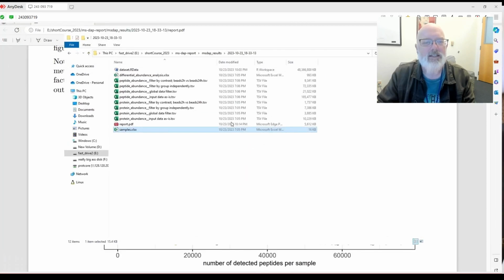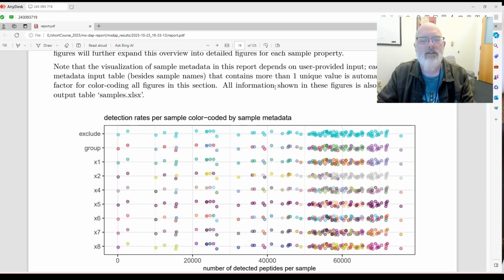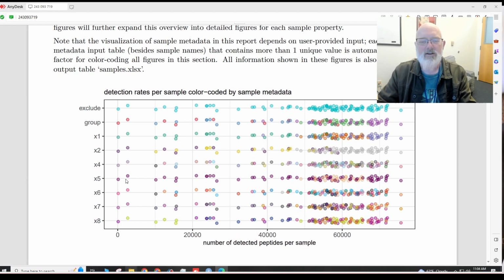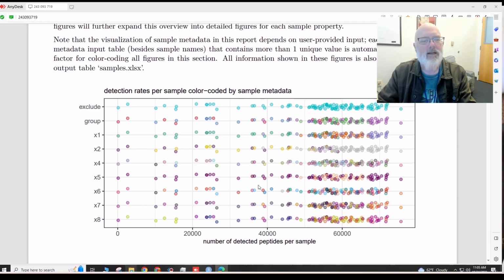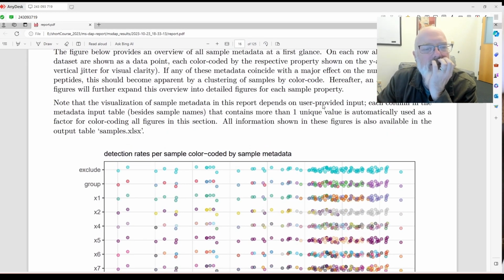So, okay, let's not save that. All right, let's go back and look at our... Anyway, that's what these X1, X2, X4, X5, X6 are. So if you put different metadata in there, it looks like you can break it out by that. And then how are these colored? That's a little confusing.